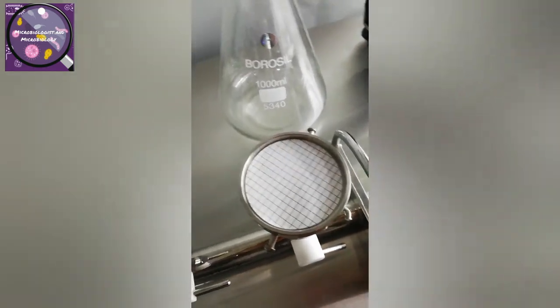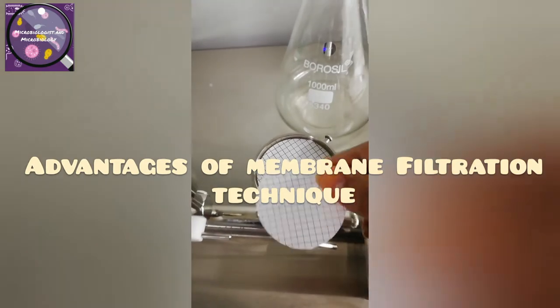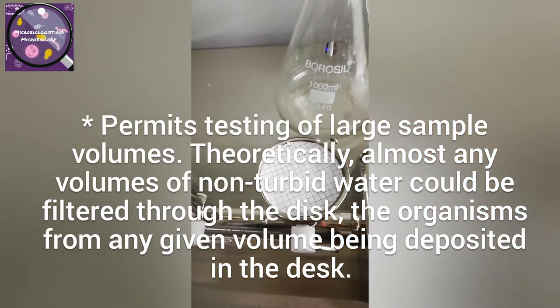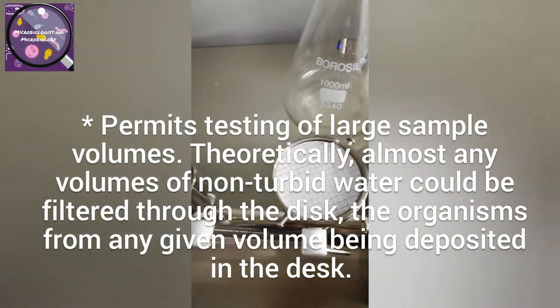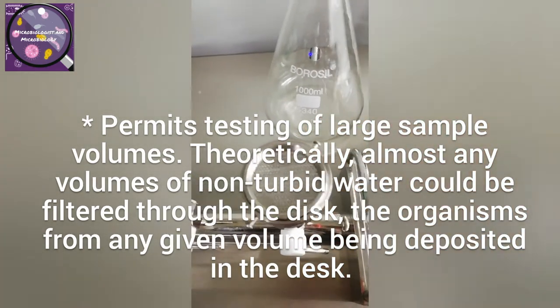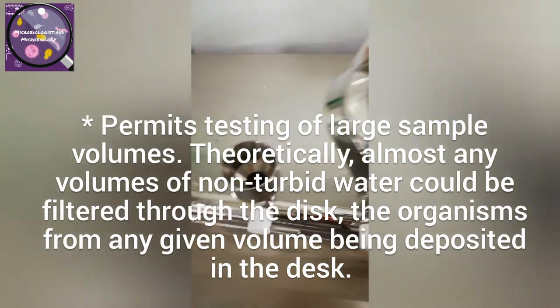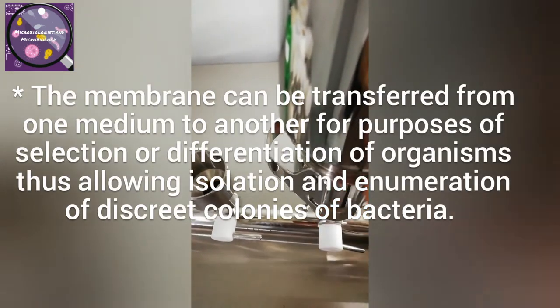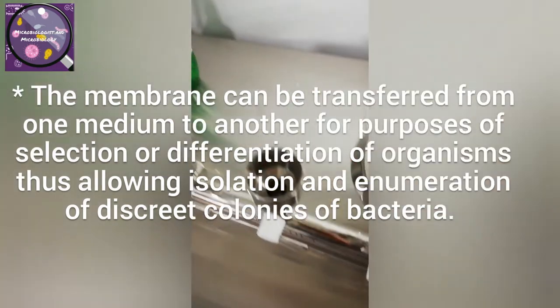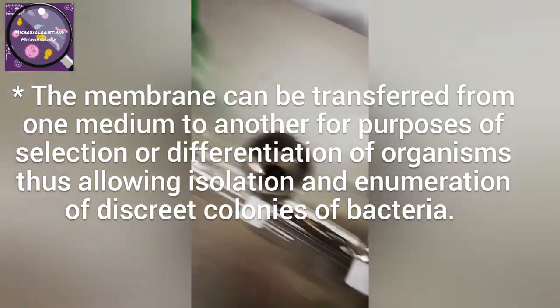Here are some advantages of the membrane filtration technique. It permits testing of large sample volumes — theoretically almost any volume of non-turbid water could be filtered through the disk, with organisms from any given volume being deposited on the disk. The membrane can be transferred from one medium to another for purposes of selection or differentiation of organisms, allowing isolation and enumeration of discrete colonies of bacteria.